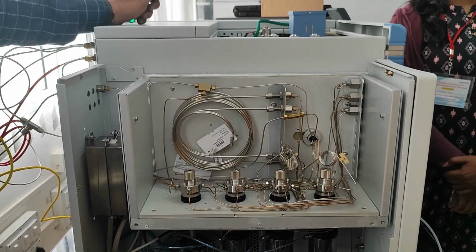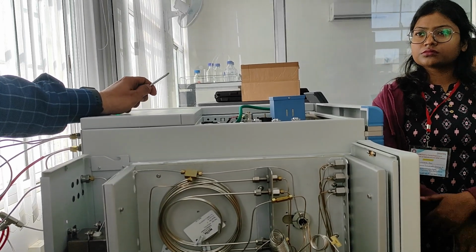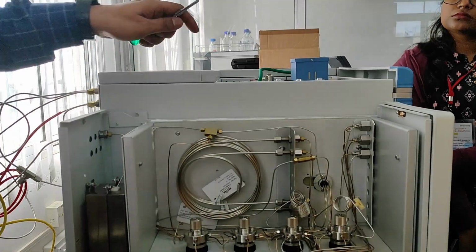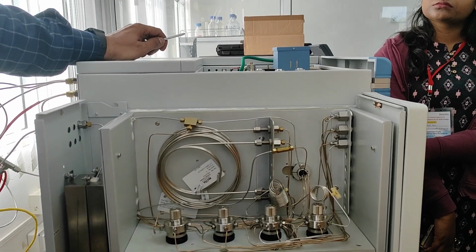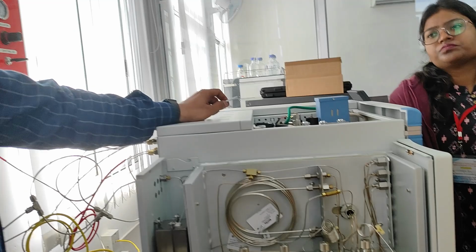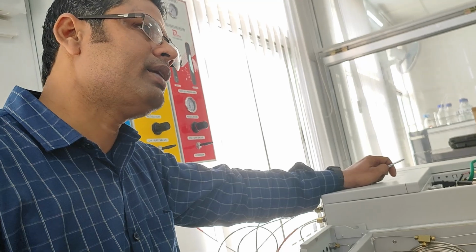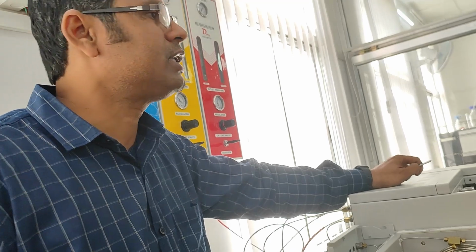See, in gas chromatography, high temperature is always good for the GC. If you use a higher temperature, your column and other components will be cleaned, because we don't know what is in our sample. Maybe some other gases or liquids may be present, and their boiling points will be very high, and they will take time to elute. So if you increase the temperature, their velocity will increase and they will come out. But it should not disturb our analysis. We have to take care.